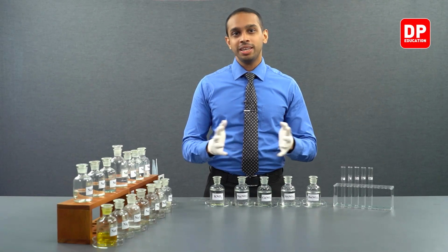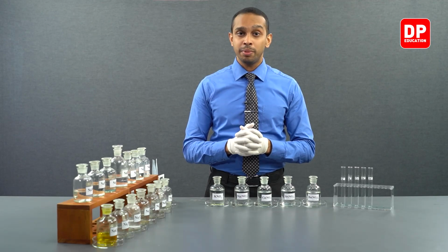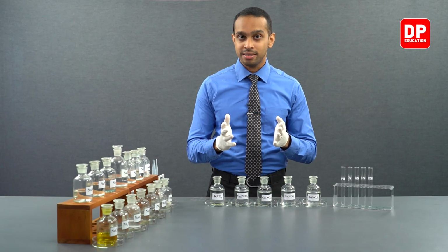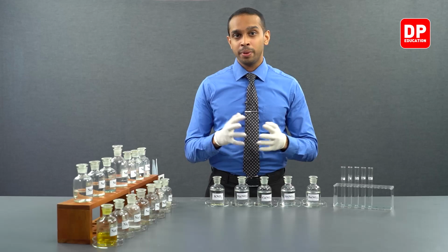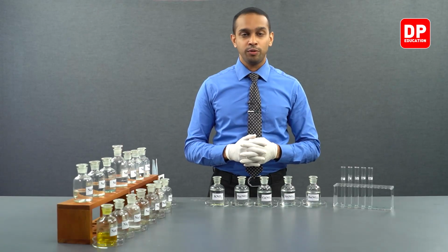Students, to conduct this practical, we'll be needing 5 different S block elements ions, and to obtain these ions, we will be taking their nitrates. So, why do we take their nitrates? Because nitrates of all of the S block elements are highly soluble in water.